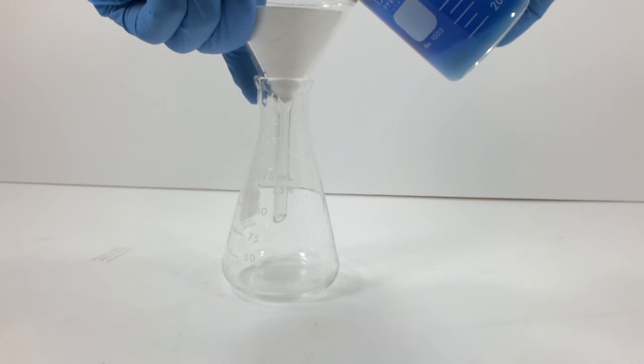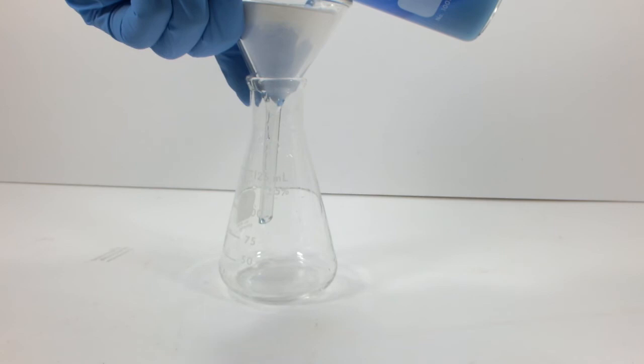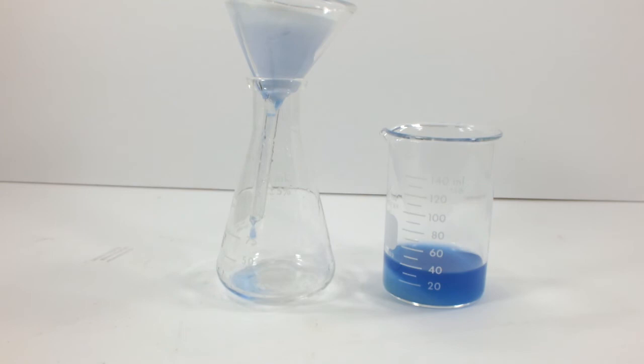Which, by the way, I quite like. The solubility is going to compromise yield, but I don't really care at this point. I just want to see how different it is in color to the other complexes. And I'm excited that the barium trick works for more than just chloride.